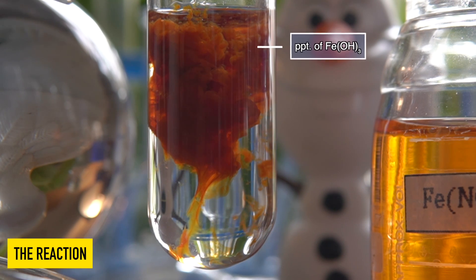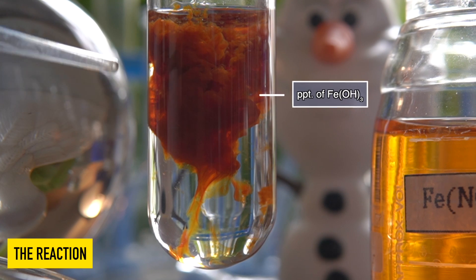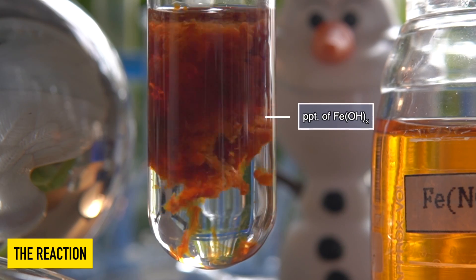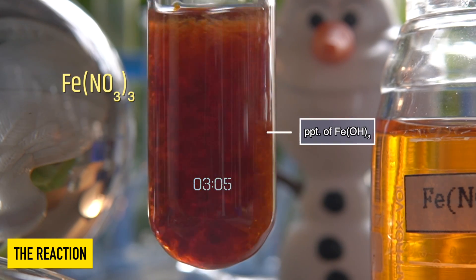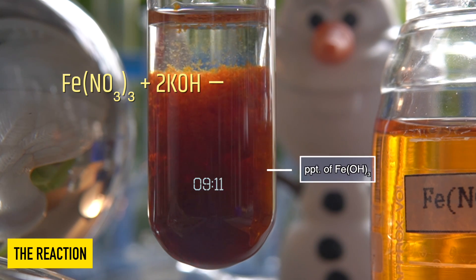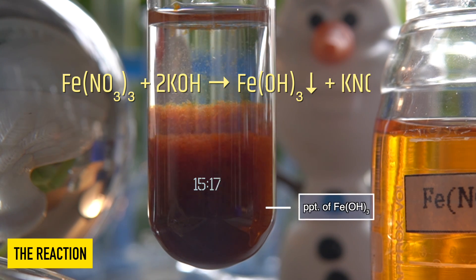The insoluble rust brown precipitate that has been formed inside the test tube is iron 3 hydroxide. In this reaction, iron 3 nitrate reacts with potassium hydroxide to produce a brown color precipitate of iron 3 hydroxide along with potassium nitrate.